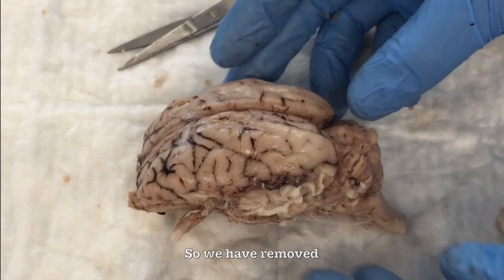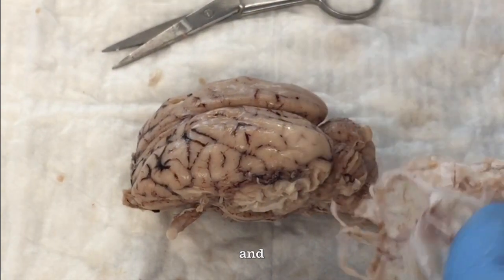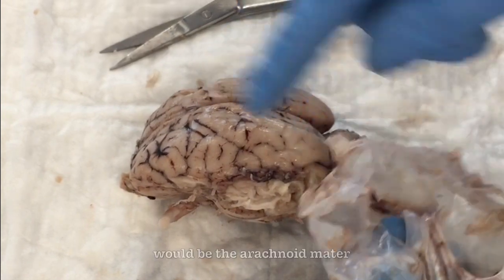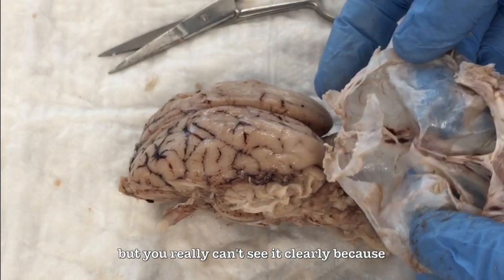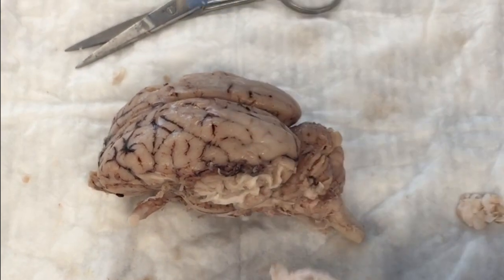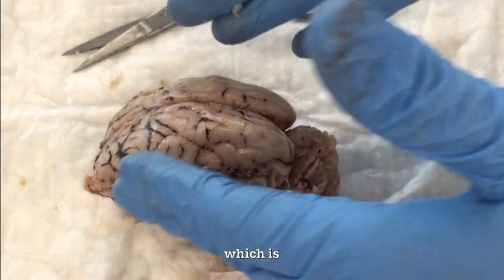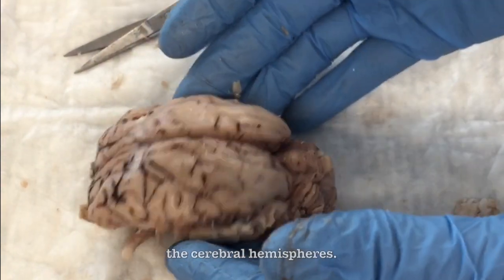So we have removed the meninges. This is the dura mater, and right below that would be the arachnoid mater, but you really can't see it clearly because in this preservative it would have dissolved. And what you're seeing here is the pia mater, which is intimately associated with the cerebral hemispheres.